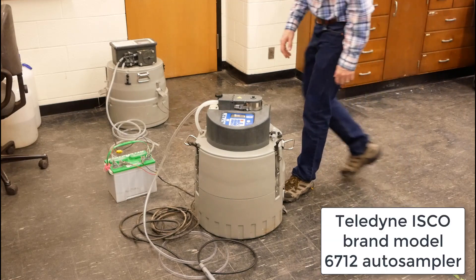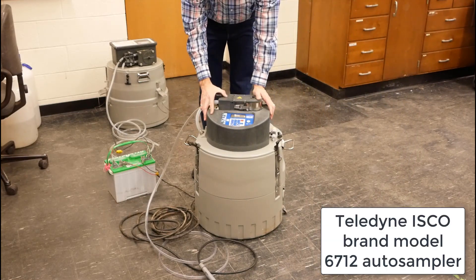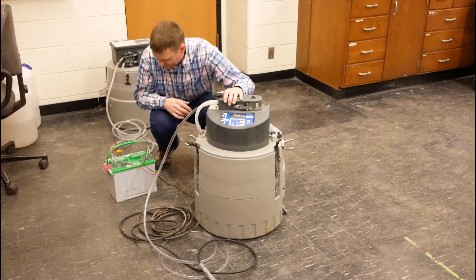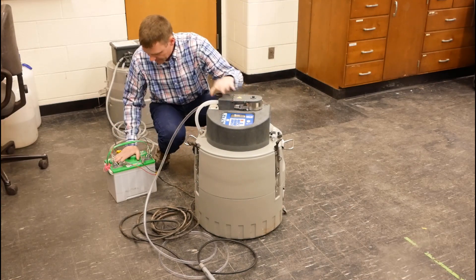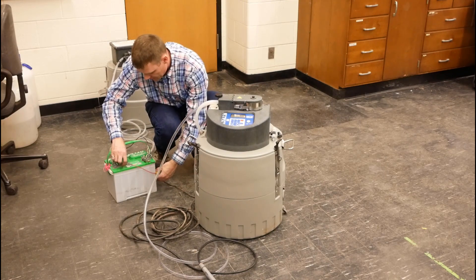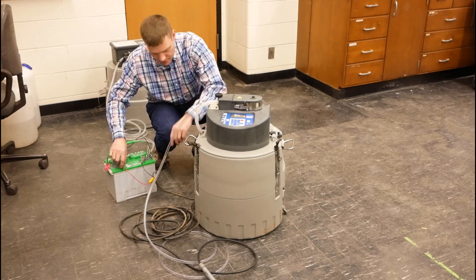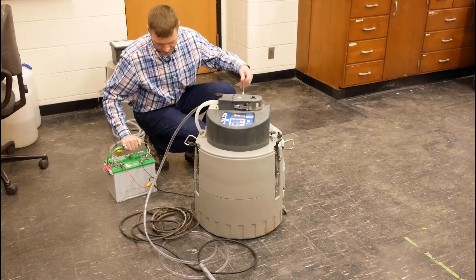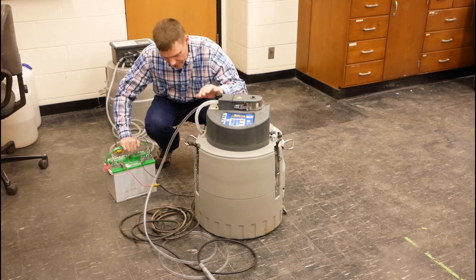This is called a 6712 — the ISCO 6712. This is the battery. You often see pictures of auto-samplers with solar panels, but the auto-sampler is not running on the solar panel. The solar panel just charges the battery. To run an auto-sampler, you either need a significant battery source like this or an electricity source.